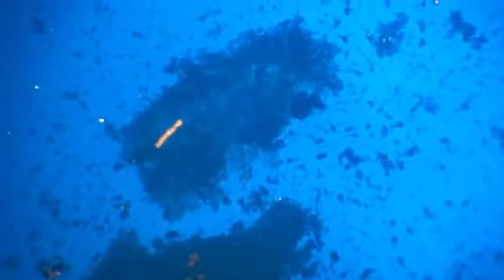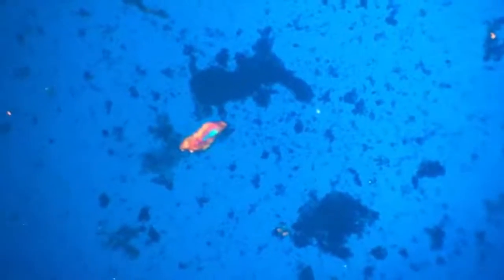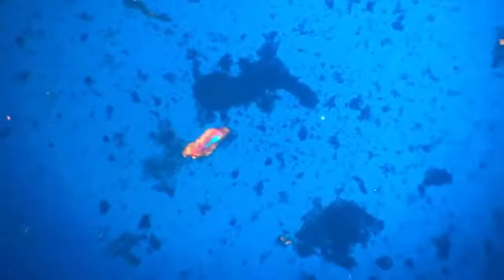The difference is very simple. I'll zoom in. Now I will rotate the filter. This is polarized condition. When the crystals, they start shining. Crystals will shine, and non-crystals, things which are not converting the light or not changing the wavelength of light, appear dark, and the other ones which are bringing some change in the light wavelength appear of different colors, like this little grain of sand.